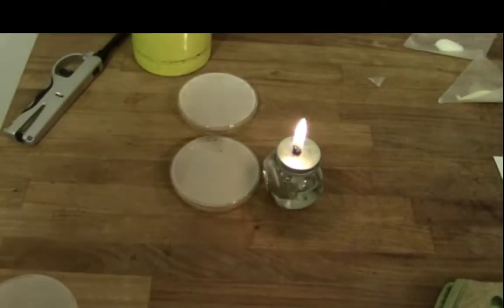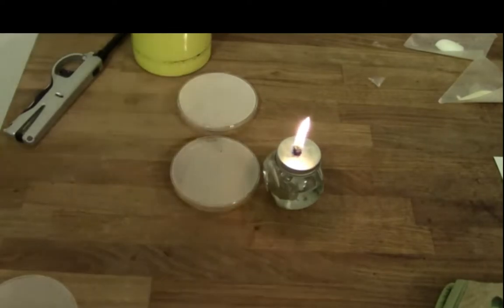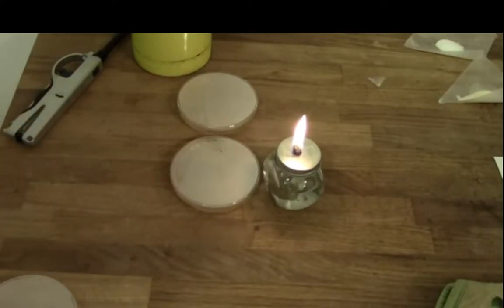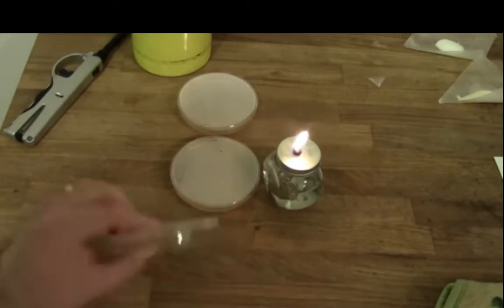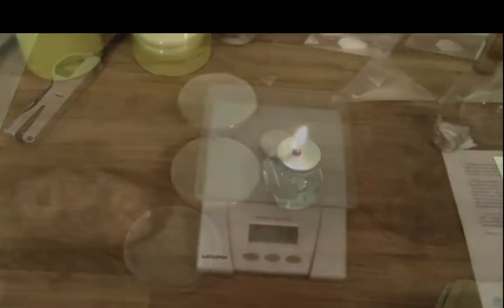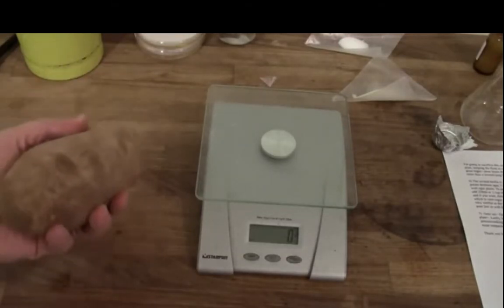Once you've finished pouring your plates, you just want to let them sit on the counter for about 20 minutes until the gel solidifies, at which point you want to immediately flip them over, because as you can see there's a fair amount of condensation on the lid, and if we were to just leave it, this would drop on the plate and ruin it. After about 20 minutes the gel will be hard enough that you can flip it. Obviously it's quite important you don't do this too early, and again I'll show you this with my sacrificial plate, but if we flip them too early, as you can see, it just spills out everywhere and makes a mess. So that's how you would make wort-based agar, but what about this potato that I've been lugging around?